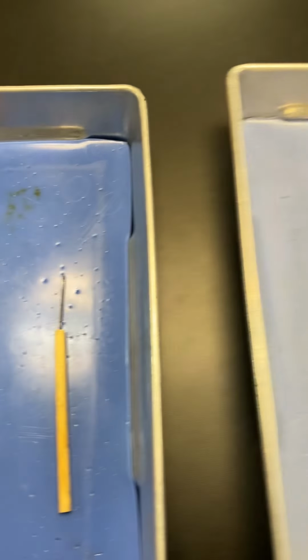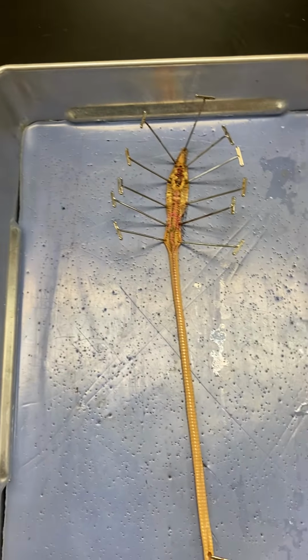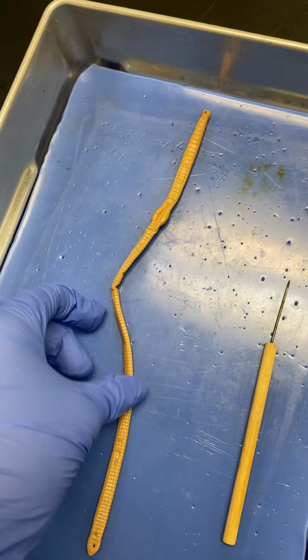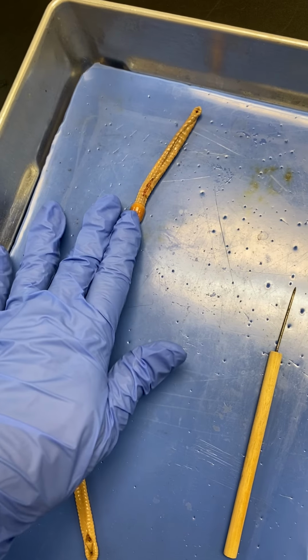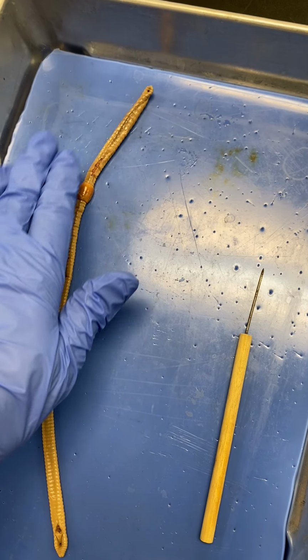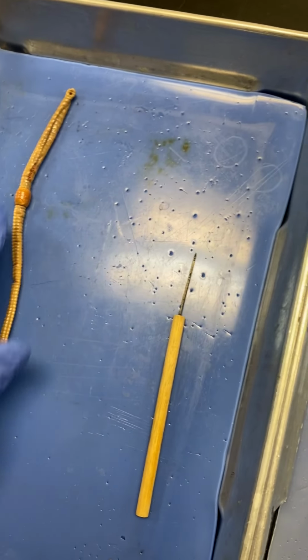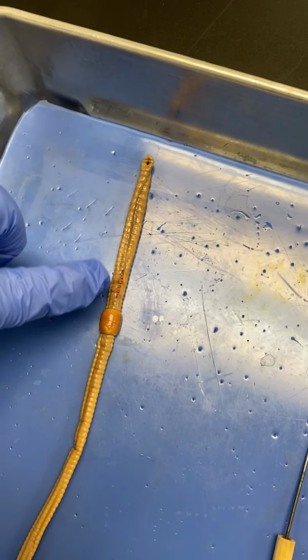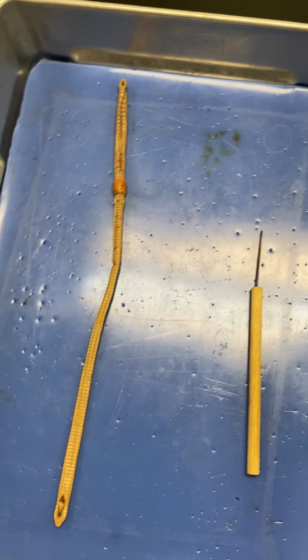So when we go to cut, the earthworm is going to be different from most of the others. Most of the others, we always cut on the belly side, the underside, or the ventral side. This one's going to be different. We are going to be cutting on the dorsal side, the back side. So the darker side where you can see that black line, the clitellum is darker. So this is the side we're going to cut. So that is very important.